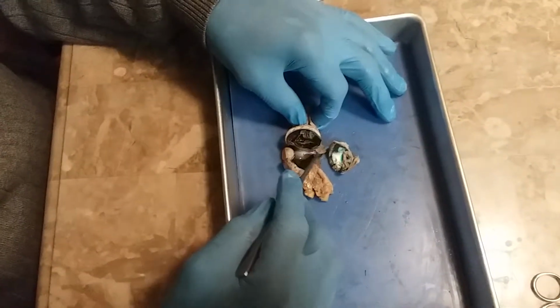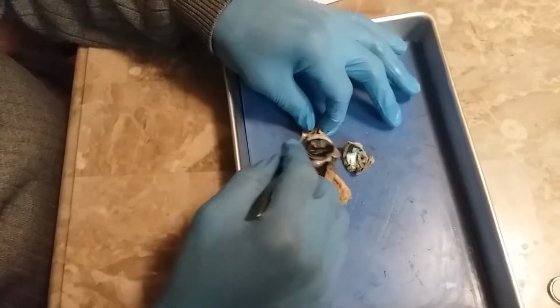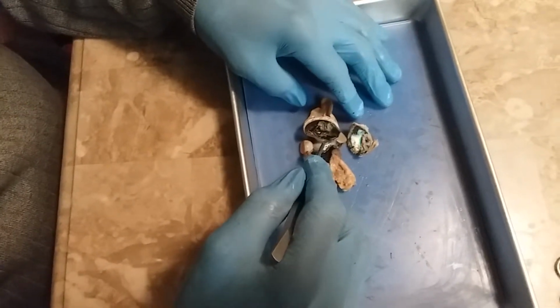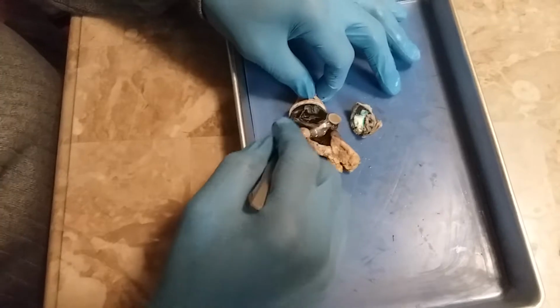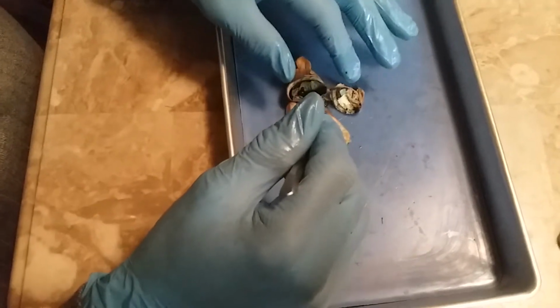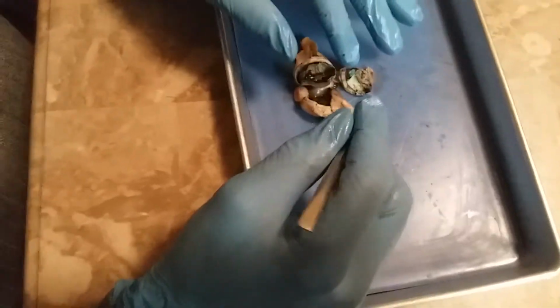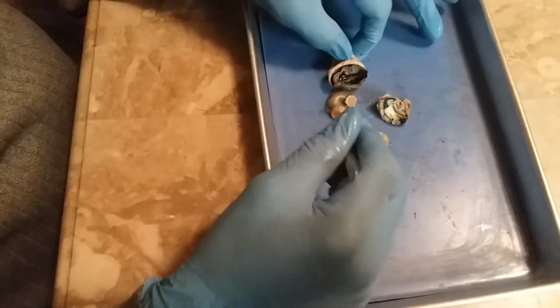The sclera is the outer covering of the eyeball, a tough opaque sheet of connective tissue that protects the inner structures of the eyeball and helps maintain its rigidity. The tapetum lucidum is connected to the choroid, operating together to help in night vision by reflecting available light back onto the retina. You can see it especially in animals that are active at night.